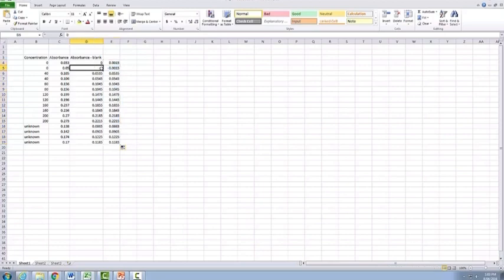So if you actually click through here on these individual cells, you can see the number up here that it's changed as we've copied it down. So C6, 7, 8, all the way down. Whereas in this one here, while the first number will change, the C6 changes to C7, the other numbers for the averages, because we've got these $ present, they don't change as we've copied this formula down. So it means then that we can actually maintain the same average along the whole way. Again, you'll still need to go back and change these two both to 0.